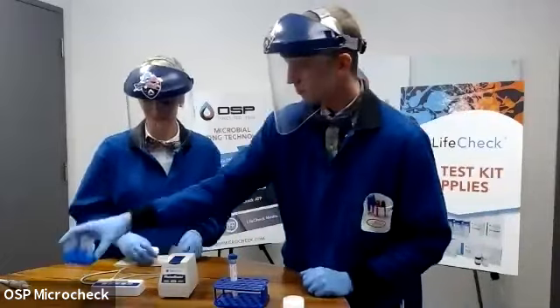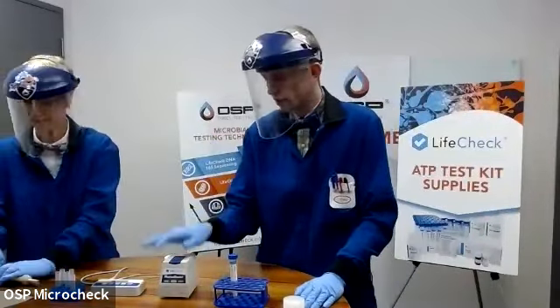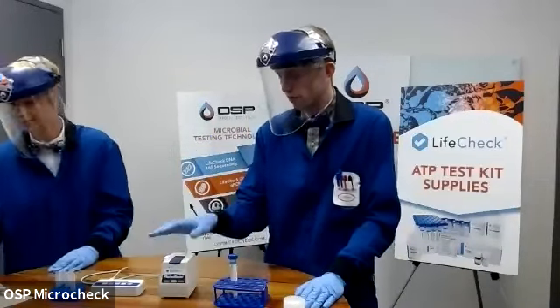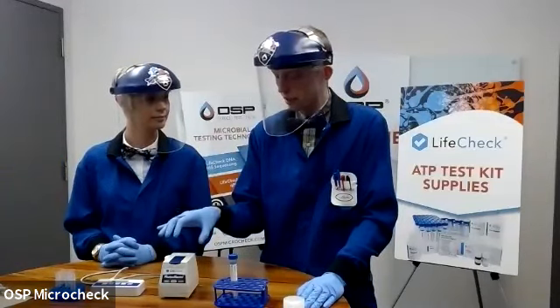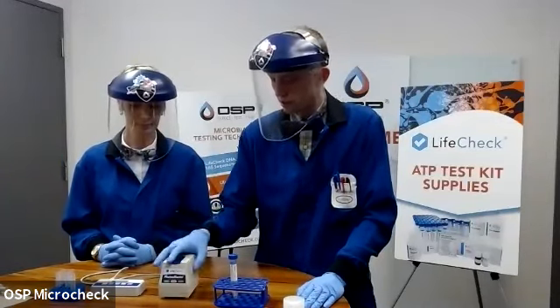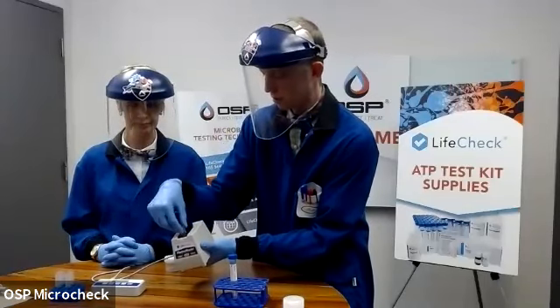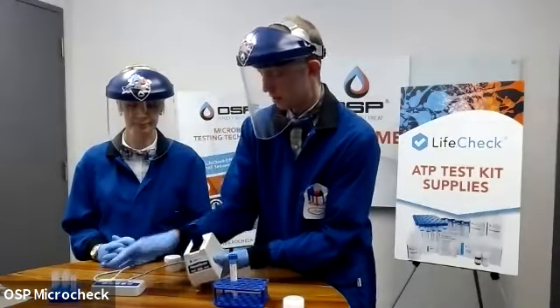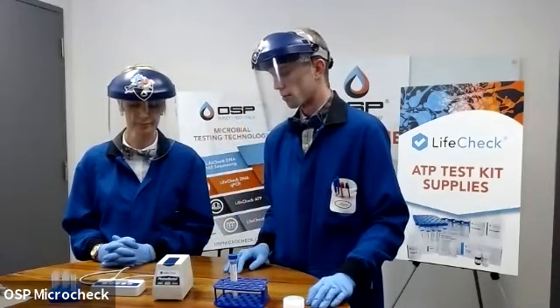Thanks for the questions. All right, so we're going to talk a little bit about the technology and the instrumentation first before we dive right back into our live demonstration. I have in front of us here a luminometer. So this is effectively a box with a spot for these little cuvettes or assay tubes to go into, and a little handheld unit that controls it and reports back the data that comes from it.